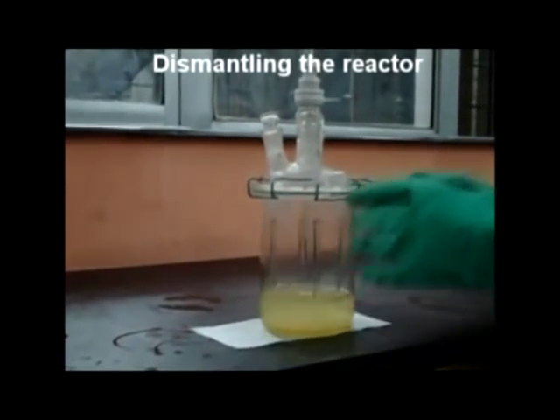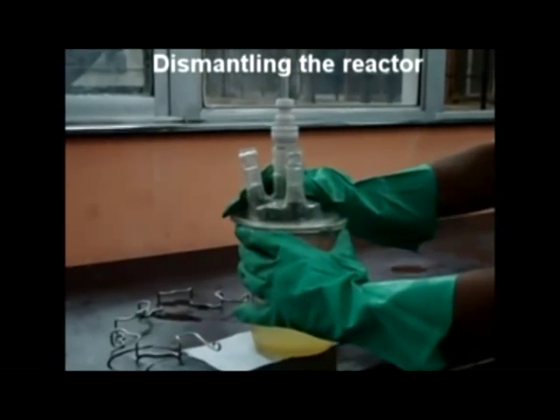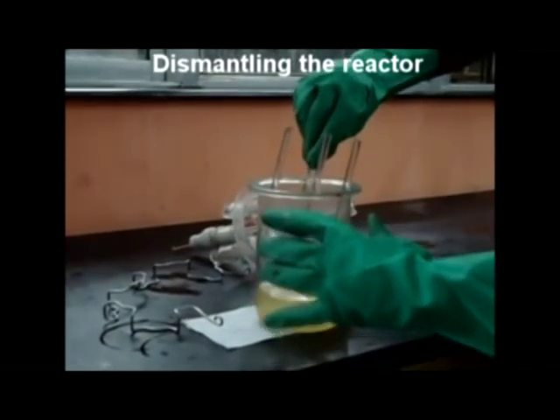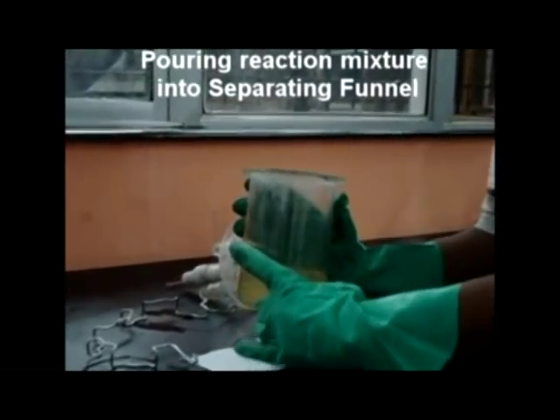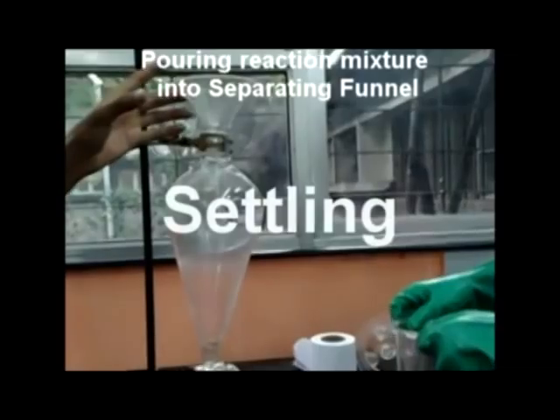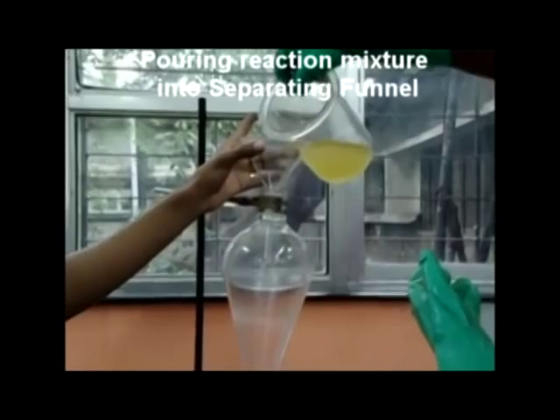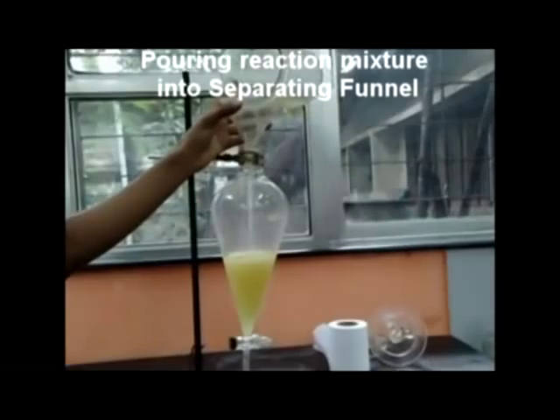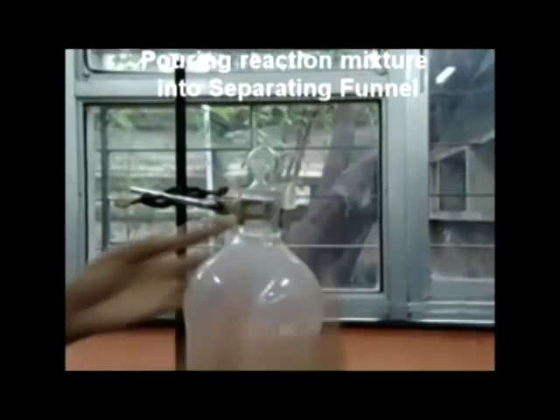Place the reactor on a tissue over the platform. Loosen the nut and remove the lock, then gently slide the reactor's lid. Remove the baffle carefully. Empty the reactor into the separating funnel using a funnel, making sure the tap is closed and lifting the funnel a little above the top. Close the separating funnel and leave the mixture for overnight settling.